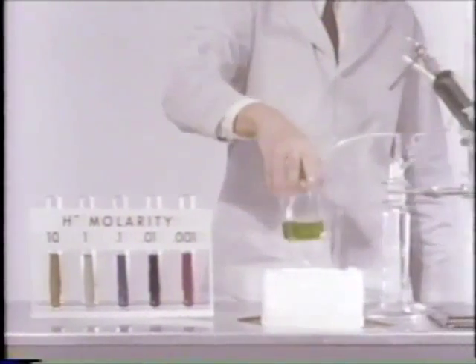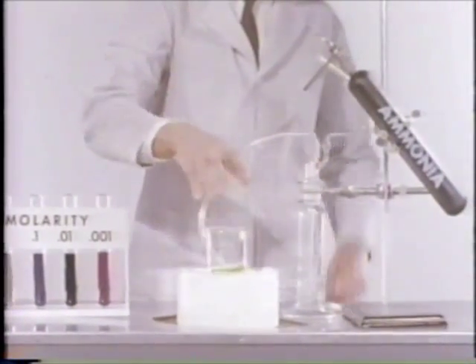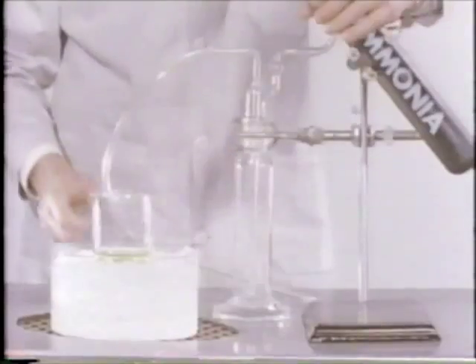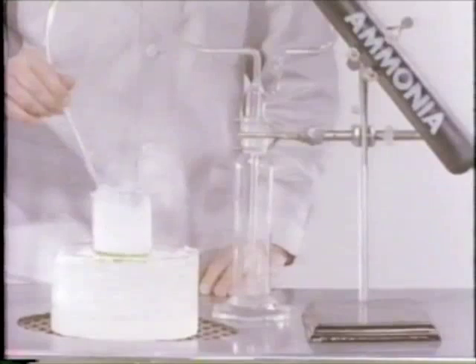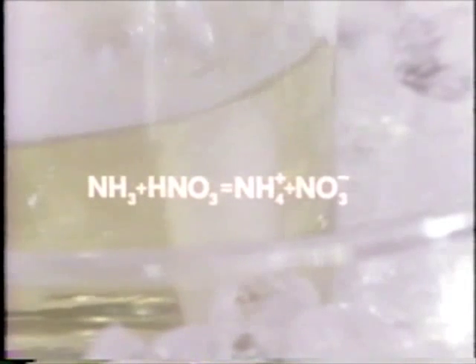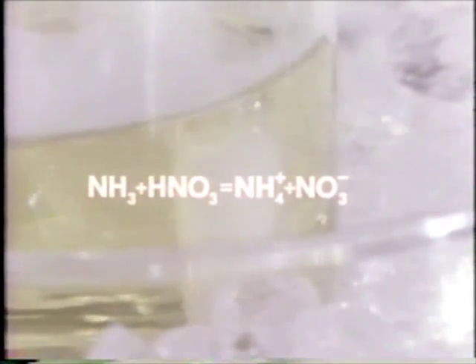If we add ammonia gas to concentrated nitric acid, the acidity should decrease. The safety trap would catch any backup of nitric acid. The ice bath absorbs most of the heat of the reaction. A glass tube with a porous tip introduces tiny bubbles of ammonia gas into the nitric acid. The white smoke — solid ammonium nitrate — forms when gaseous ammonia and gaseous nitric acid react above the solution. The net reaction is: ammonia plus nitric acid gives ammonium nitrate.